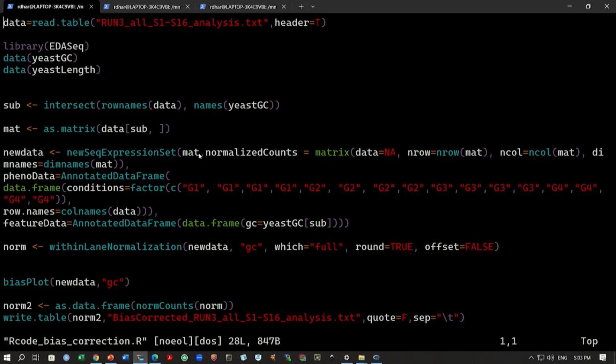Then you have the pheno data, which is given as the annotated data frame, which gives us the conditions or the factors of this experiment. As you can probably see, the first 4 samples belong to group 1, the next 4 samples belong to group 2, the next 4 belong to group 3, and the final 4 belong to group 4. So this is what we are mentioning when we say this factor.